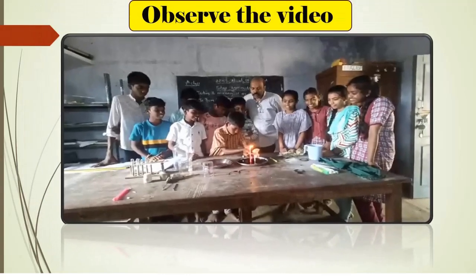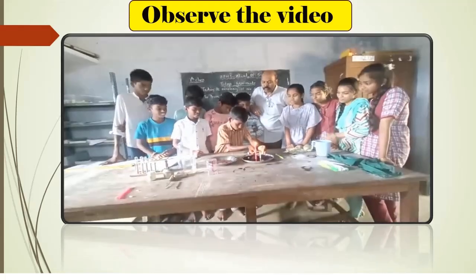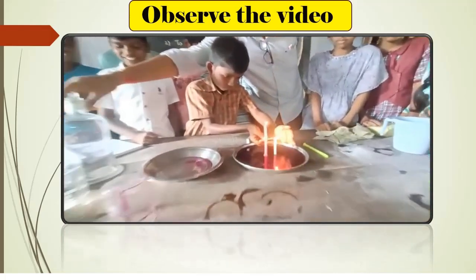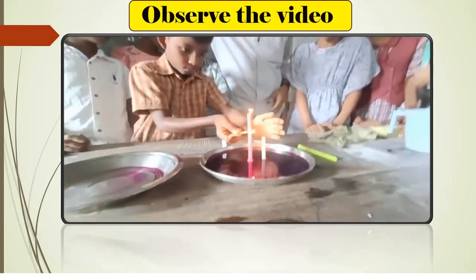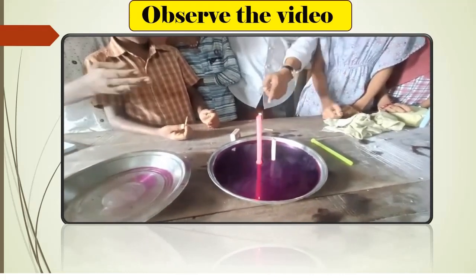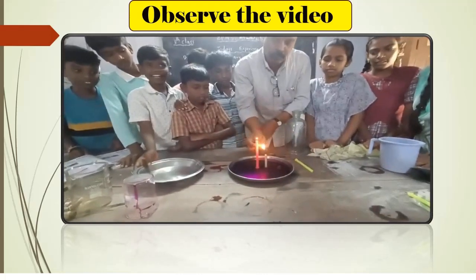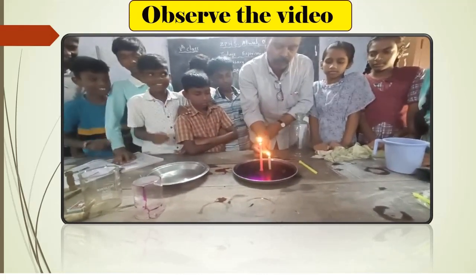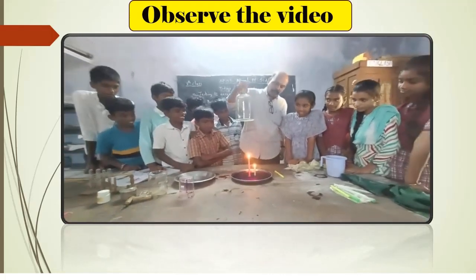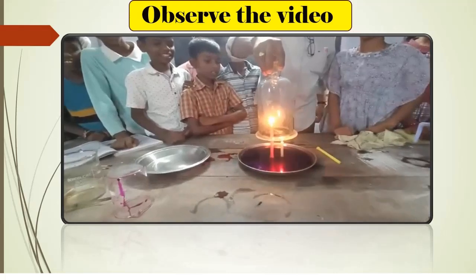So here, first light the 2 candles. Observe carefully. Here one is a big candle and one is a small candle. First of all, you have to light the 2 candles. A bell jar should be placed over the 2 candles. Now observe carefully.